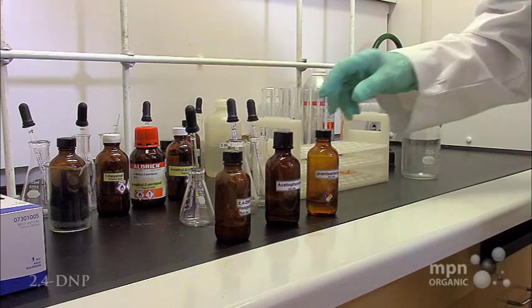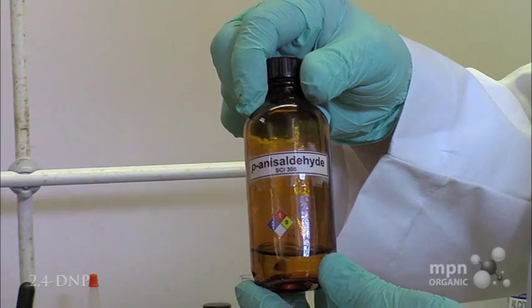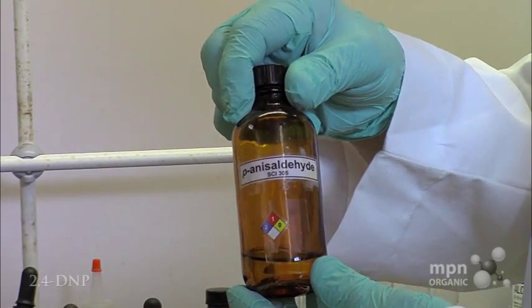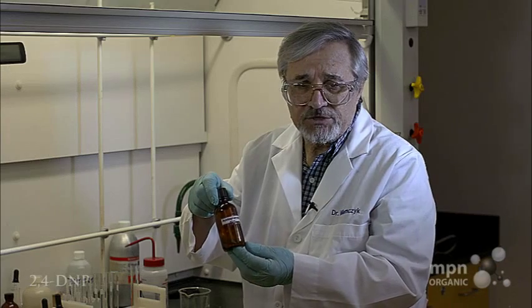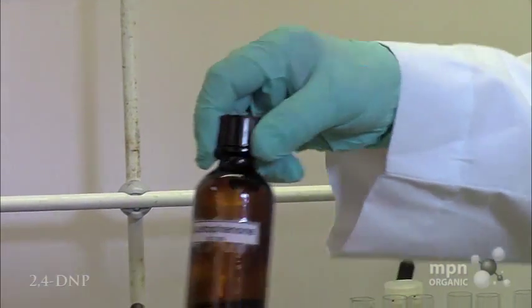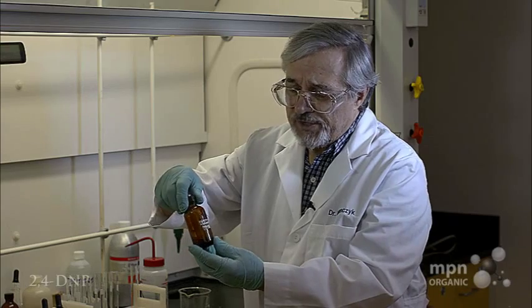What we're going to do is demonstrate that for you today. I've got an aldehyde, paraanis aldehyde, here it is, and acetophenone, which is a ketone. And we have the 2,4-dinitrophenylhydrazine reagent.